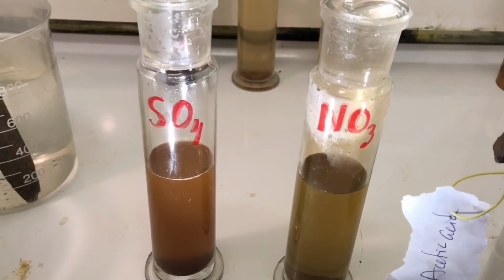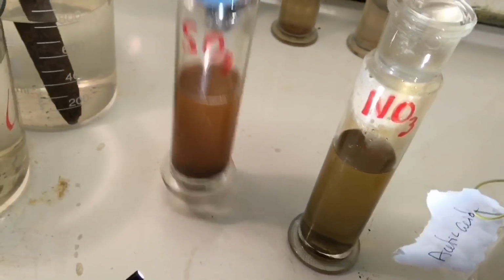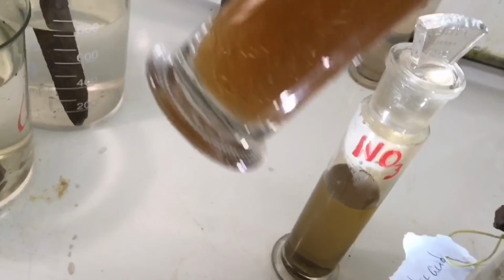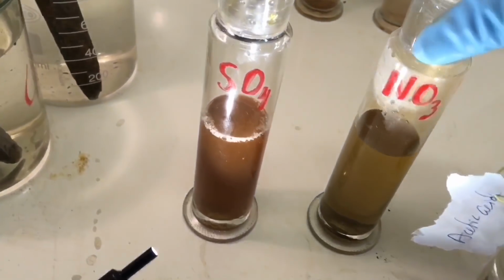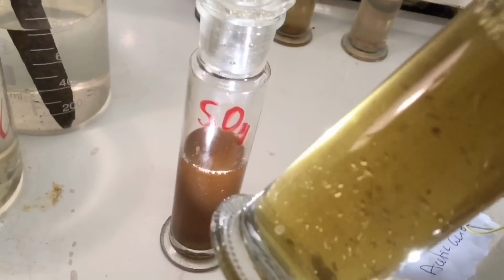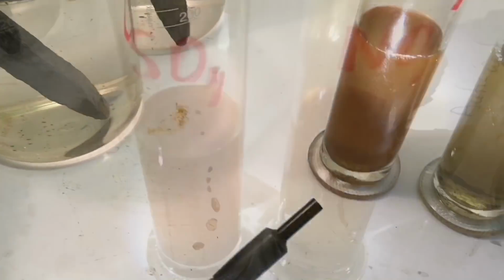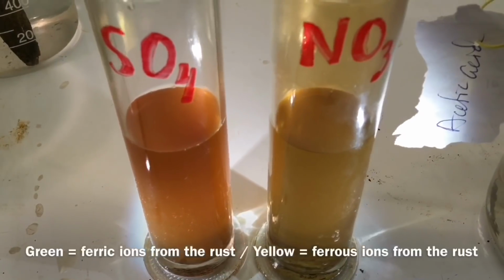Well, it seems like the sulfuric one is slightly more brownish. You can see I can shake it around a little bit here. And there's also some flakes still left in that one. Whereas the nitric one is a little bit more green. Also some flakes in that one. If we take a close look at them under the light, the sulfuric acid appears to have dissolved a little bit more than the nitric acid.